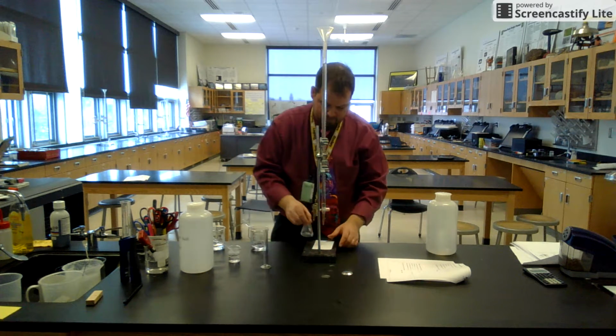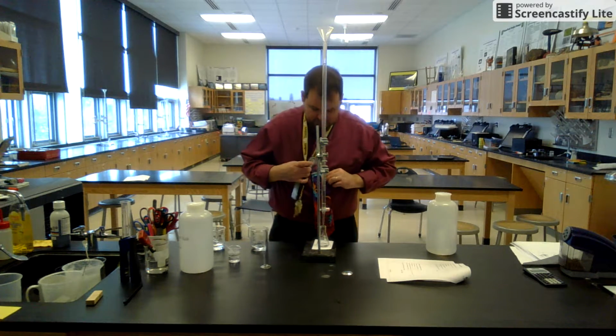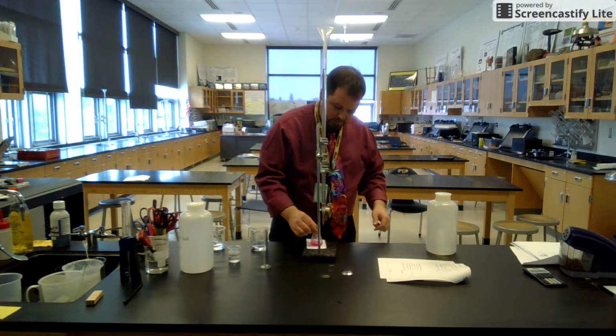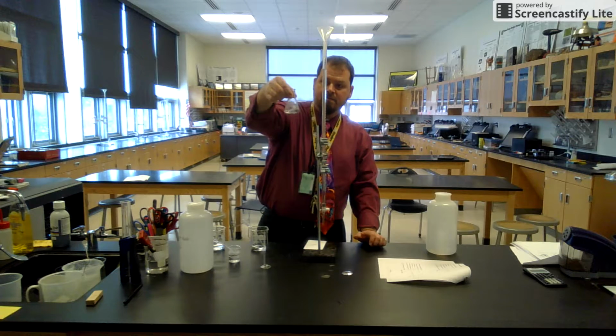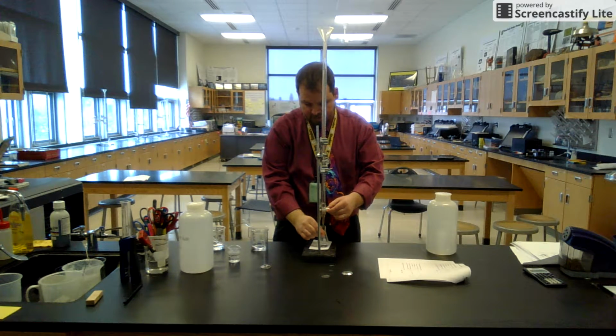Okay, now I'm going to actually titrate. I'm going to titrate until this is where we compete for the lightest pink possible. I'm going to shoot it fast so you see the pink. I think everybody on camera can see that, and boom, oh, see it go away? So now I'm not done. But that pink, by the way, was way too dark. We want to go for the lightest pink possible.